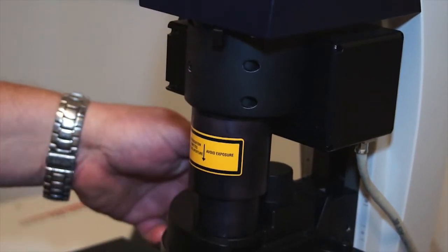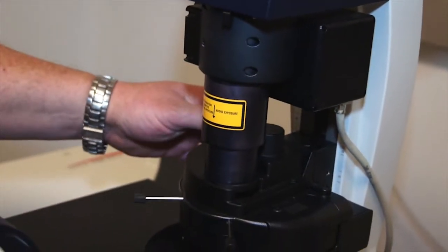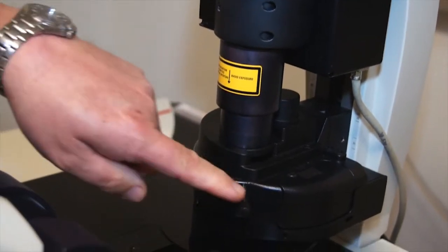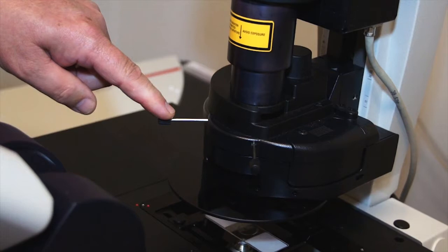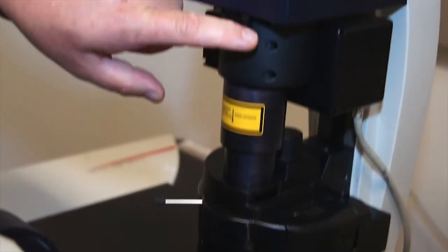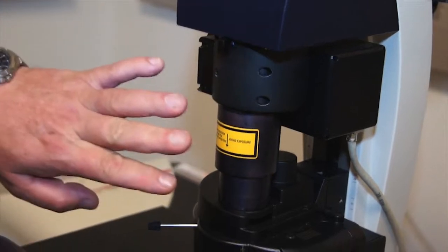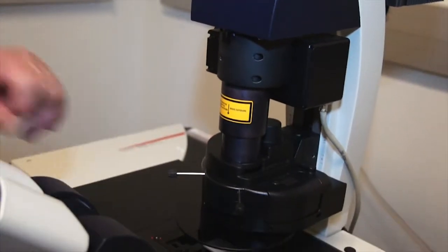Then we raise and lower the condenser until those leaves are nice and sharp. We align the field diaphragm to the field of view using the two alignment knobs, and then open the field diaphragm just outside the field of view. Now our microscope is aligned at that objective.